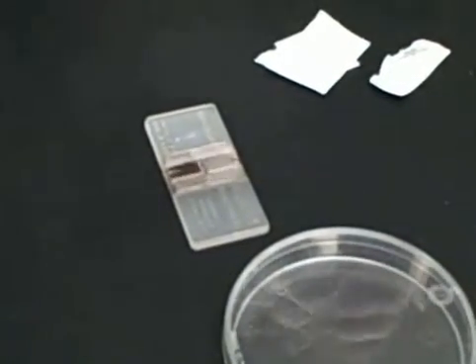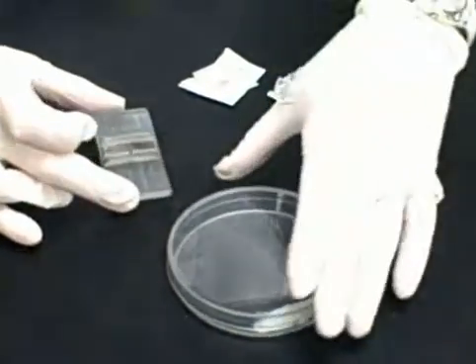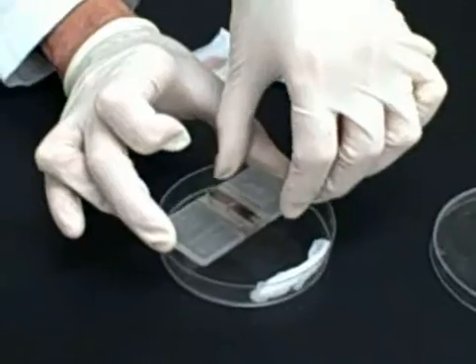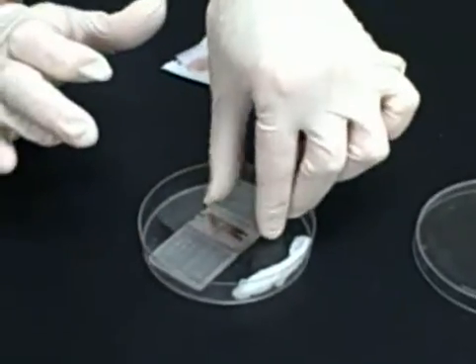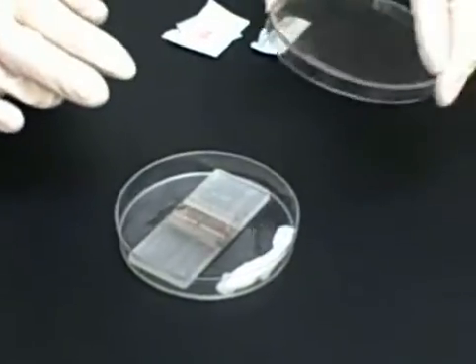Once loaded, it should sit for a few minutes so the cells can settle before counting them. To keep it from drying out while it sits, put it in a small petri dish with moistened gauze.